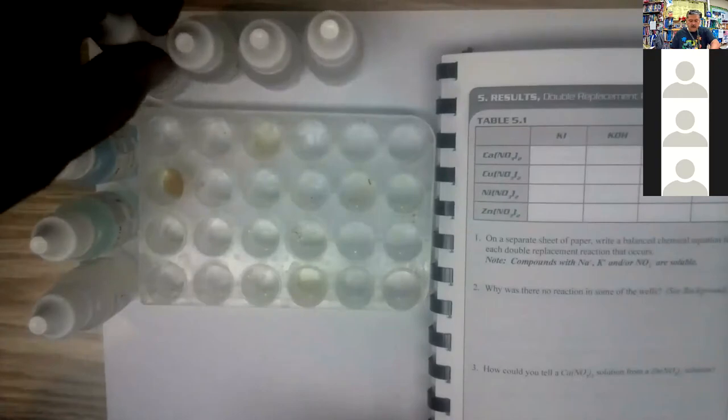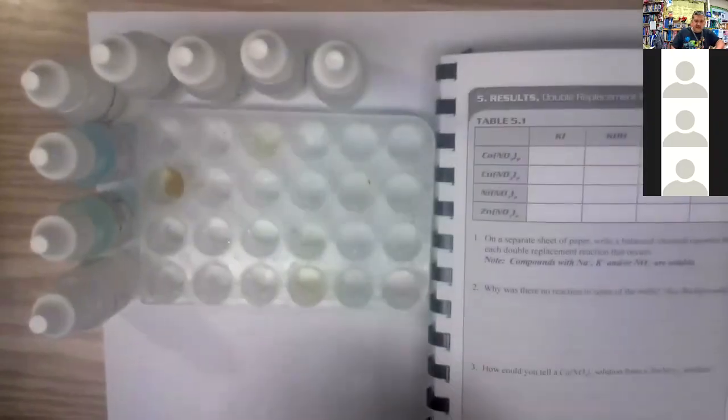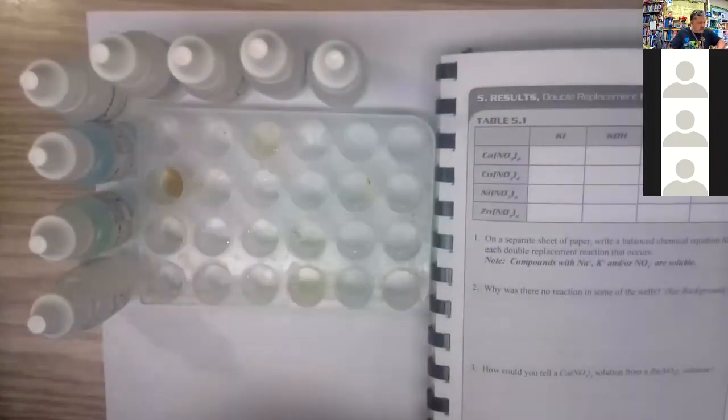Okay. Now, real quick, before we move on, let's go ahead and take your observation. You look at your observation, you can see that this one did turn the color. And I've got my planner here, which is a good dark background. Look at this one with the dark background.